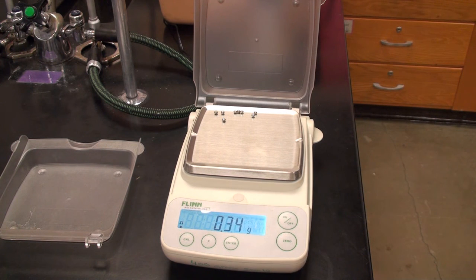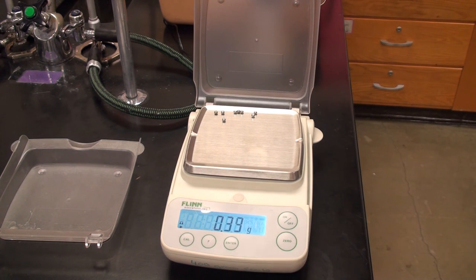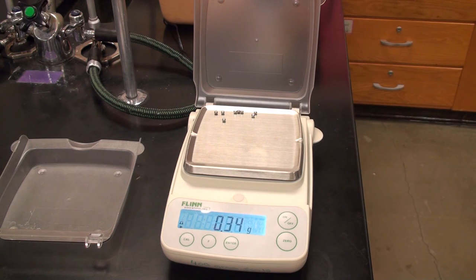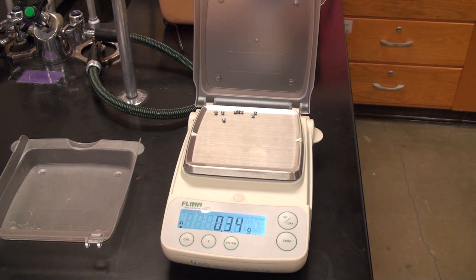All right, that looks good. So, what you have here is 7 different beads. And we need to figure out the average mass. So take all those numbers and determine what the averages are, right? And then what we're going to do next is I'm going to put a bunch of those beads on here, and you're going to use that average to determine how many beads there are mathematically. I'll tell you later on how many I had, and we're going to see if your calculations are correct.